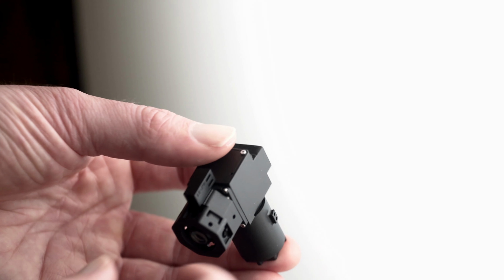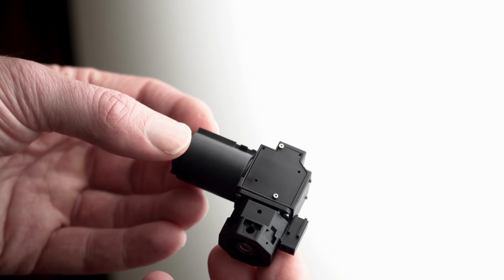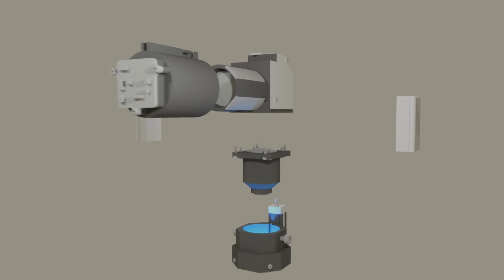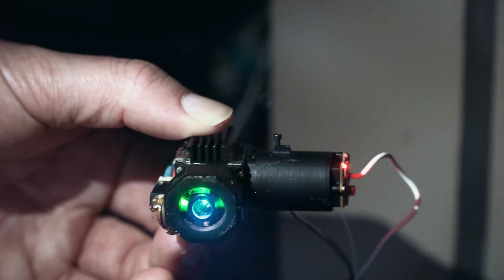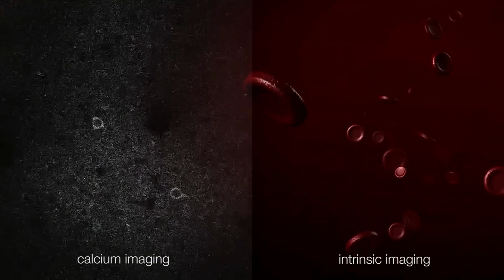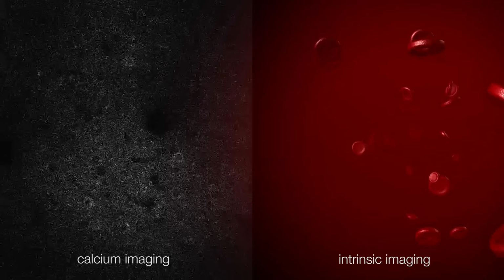We designed cScope with three key features in mind. It should have as large a field of view as possible, it should be open source, something you can fabricate in your own lab, and it should have a two-channel illumination system for simultaneous calcium and intrinsic imaging. The imaging field of view we developed was over 30 square millimeters.